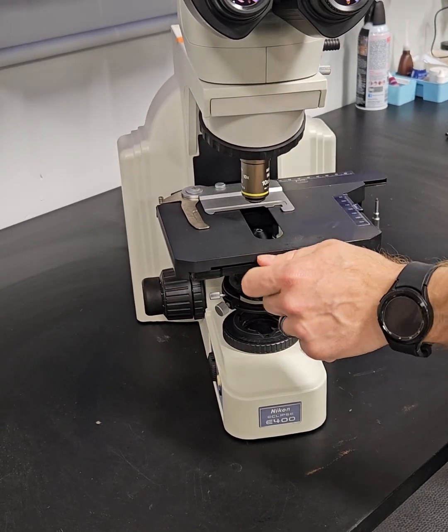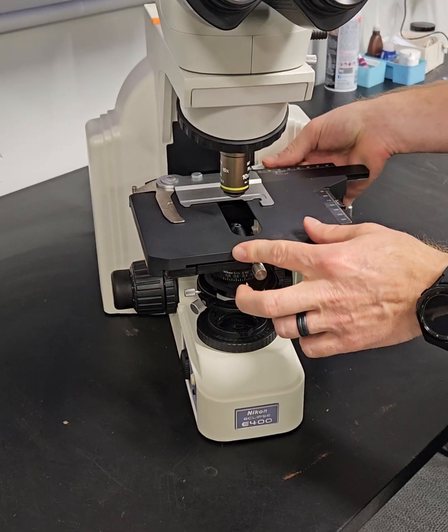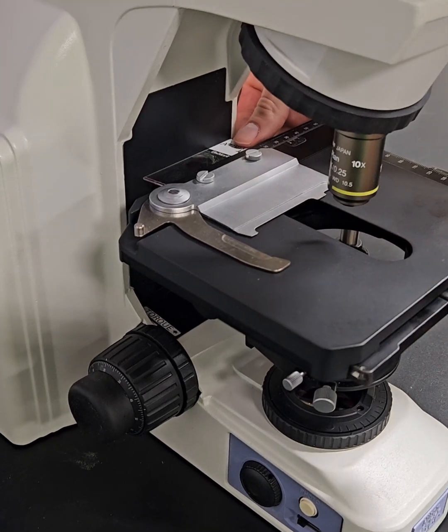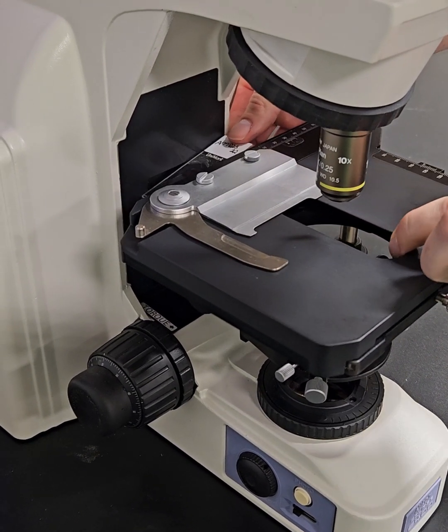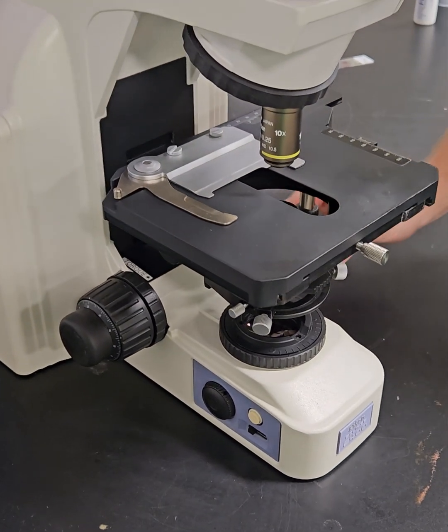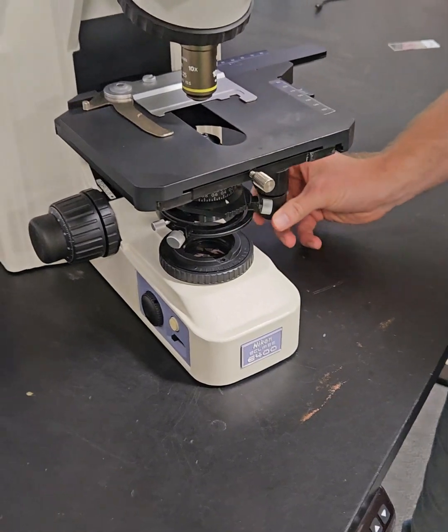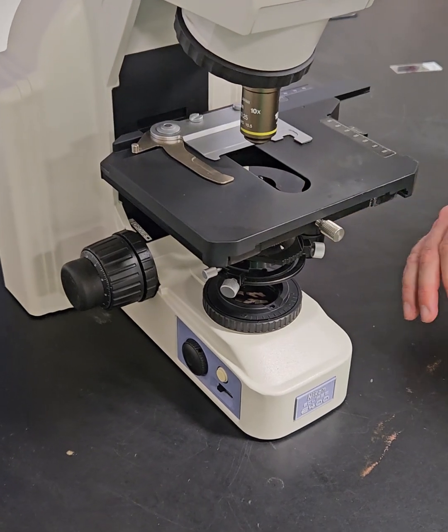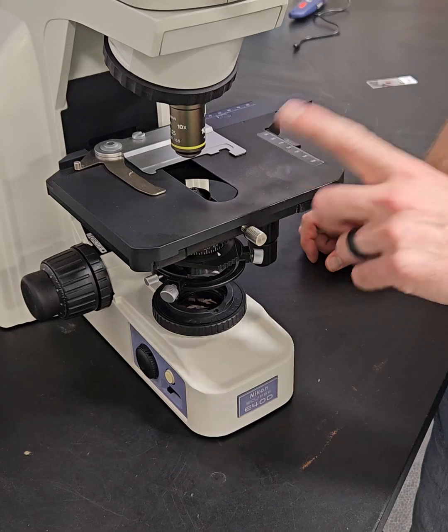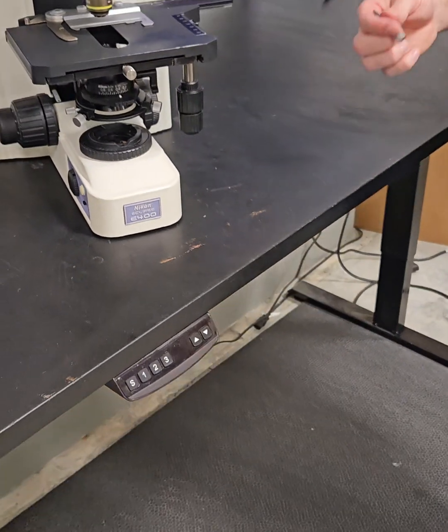Whenever you're putting these stages on, always take a slide, like an old slide, loosen the stage a little bit, put it behind, push your stage back, and then lock it in. And the reason you do that is to make sure your stage is perfectly square. If it's not perfectly square, whenever you're scanning your slide, the slide can go diagonally. And so if you're scanning the X direction or the Y direction and the specimen is going at a diagonal line, either your head has an issue or the stage itself is on crooked. So those are the Nikon stages.